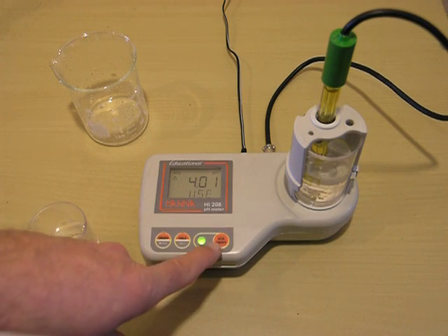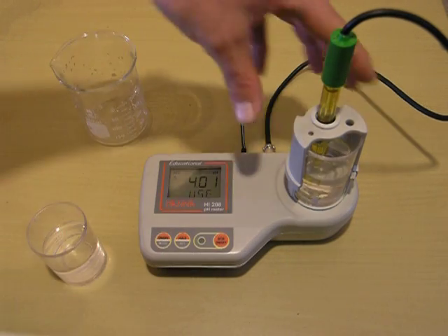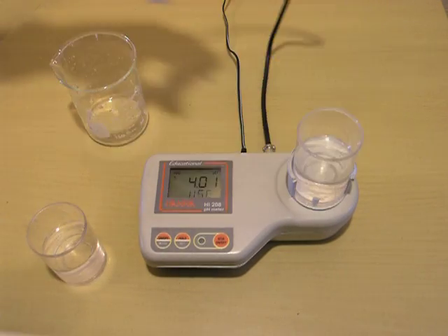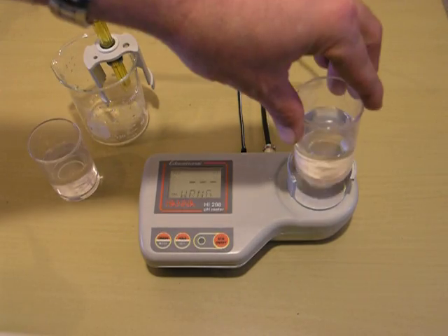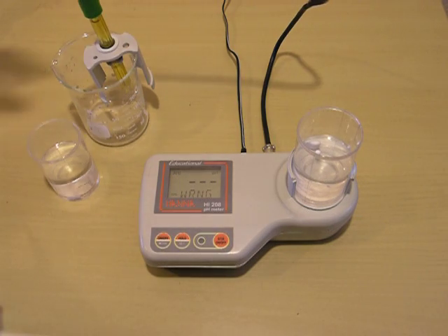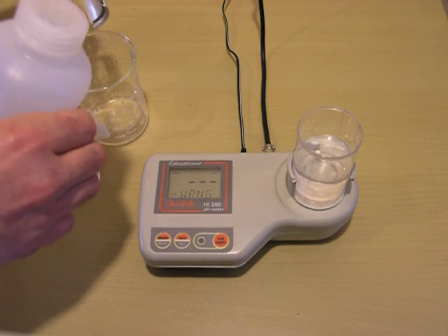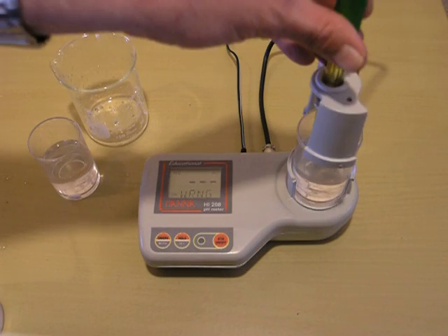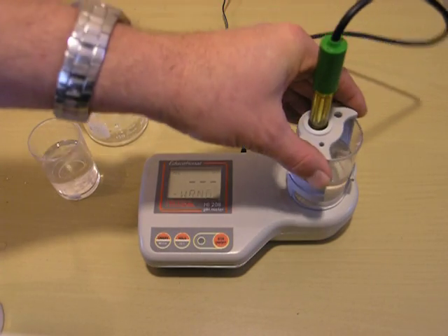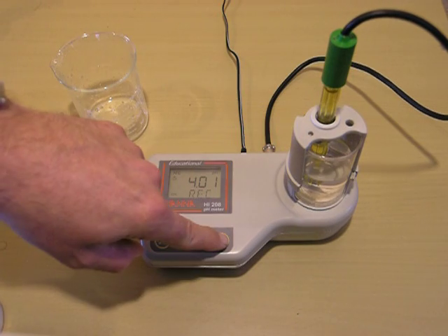So we've finished. Now it says use 4.01, so we'll turn the stirrer off. Remove the probe, add our 4.01 buffer, give the probe a rinse, and replace it.